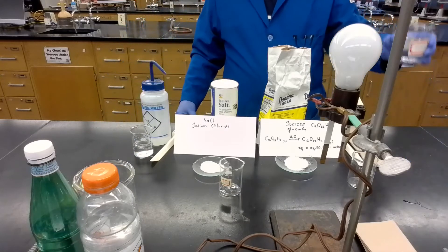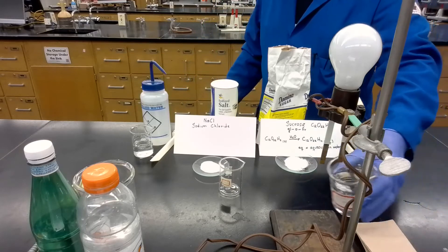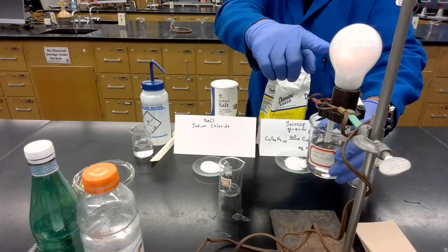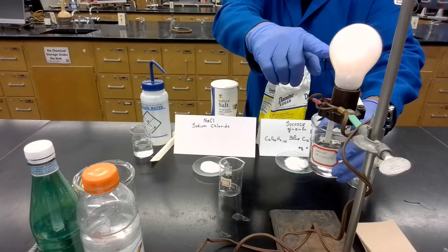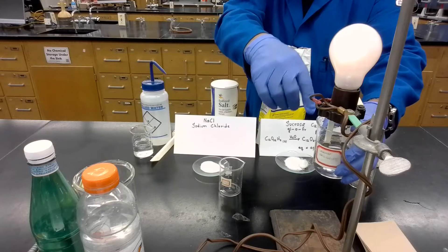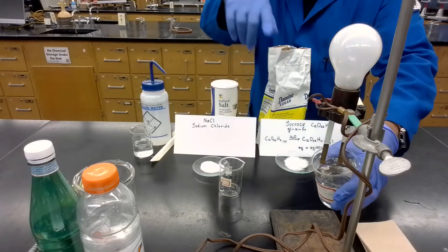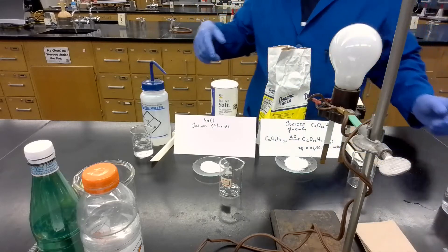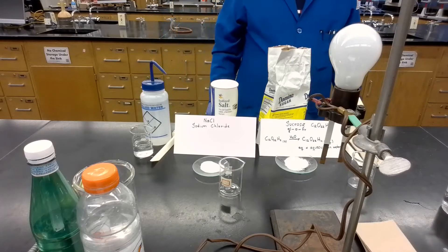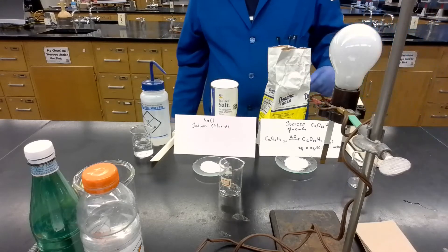We're going to use tap water now. As you can see, there's a very dim light over here. We can conclude that there is something in the tap water that helps the flow of electrons between the two terminals. We will discuss that later.